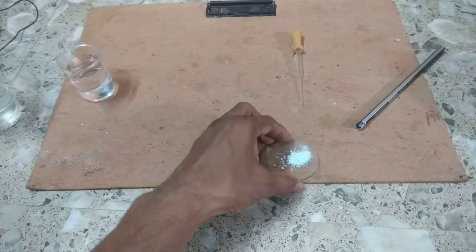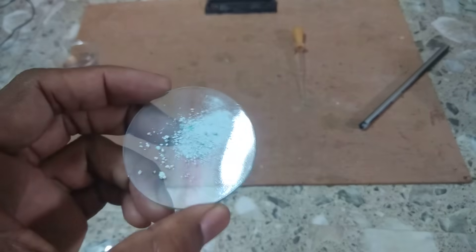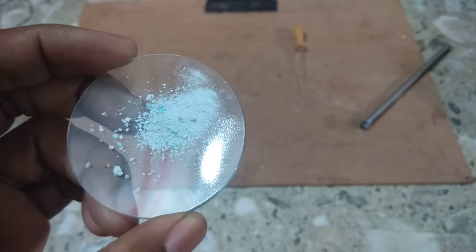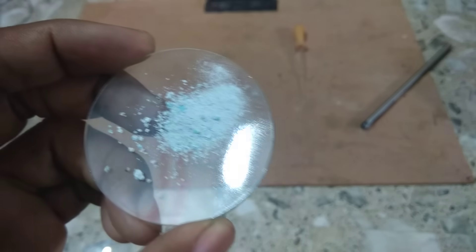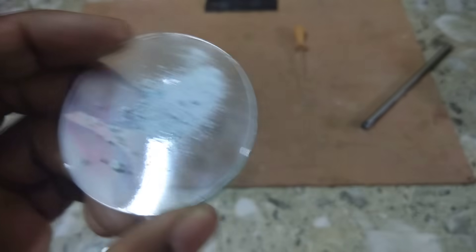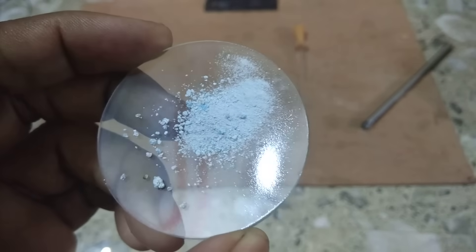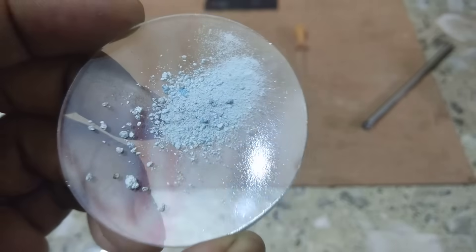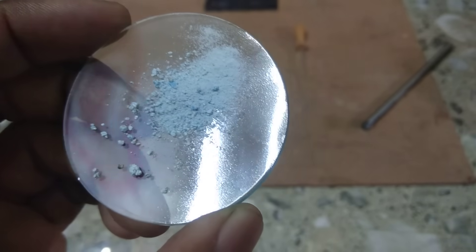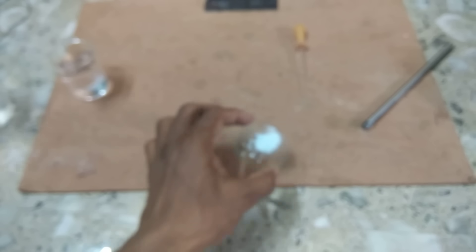We have taken the heated copper sulphate and you can see this is white in color. That means the blue copper sulphate changes into white color — it loses its water of crystallization, that is 5H2O. This is copper sulphate but white in color. Now let us see what happens if we put water to this white copper sulphate.